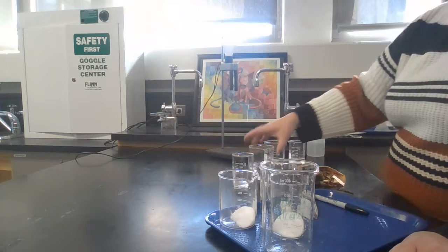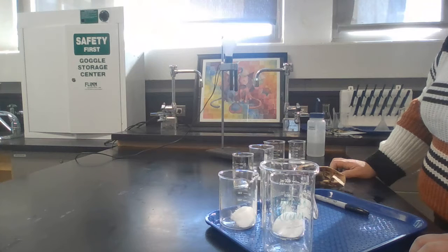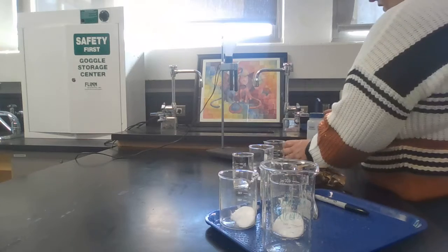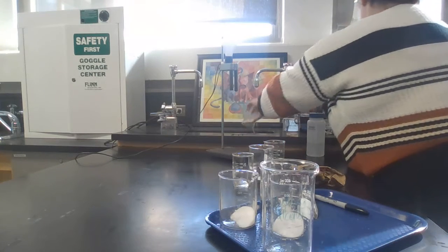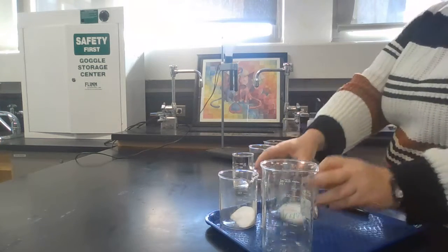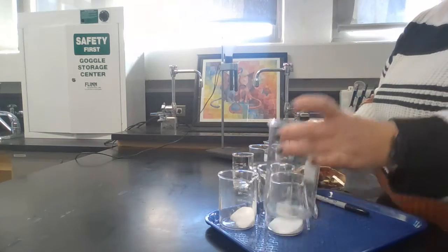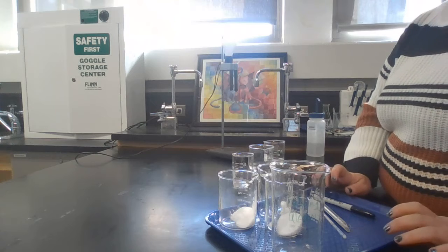So you write whatever ones light up. If you end up not having enough water to cover both probes, just add more water and stir it again. Once you are done, you can dump all of these in the sink and rinse them out and put them on a drying rack. You can leave your 3 substance beakers and your 1 water beaker on your tray and put your tray back in the back of the classroom.